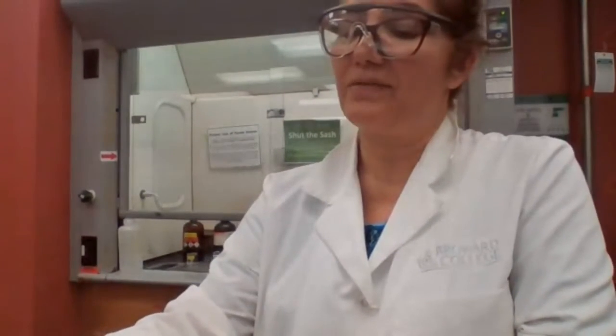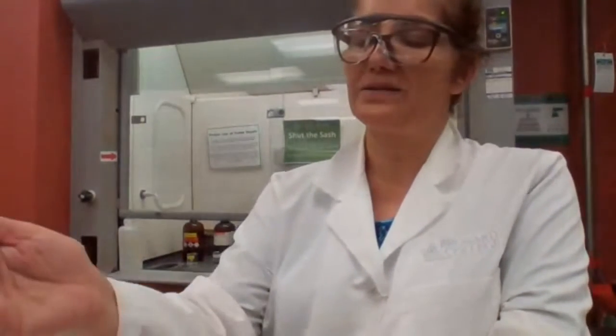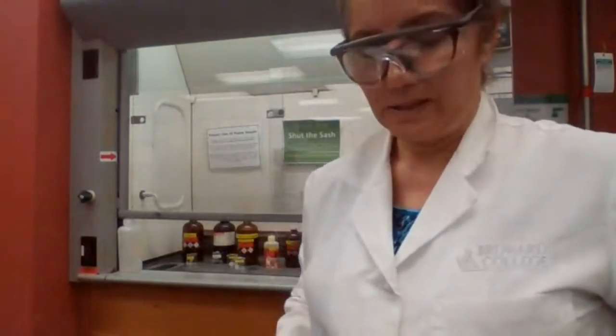So we are going to test the secondary alcohol that we have here, but the condition is not just being a secondary alcohol. It has to be a secondary alcohol where OH is on the second carbon. So basically, if you oxidize it, it would change to a methyl ketone.